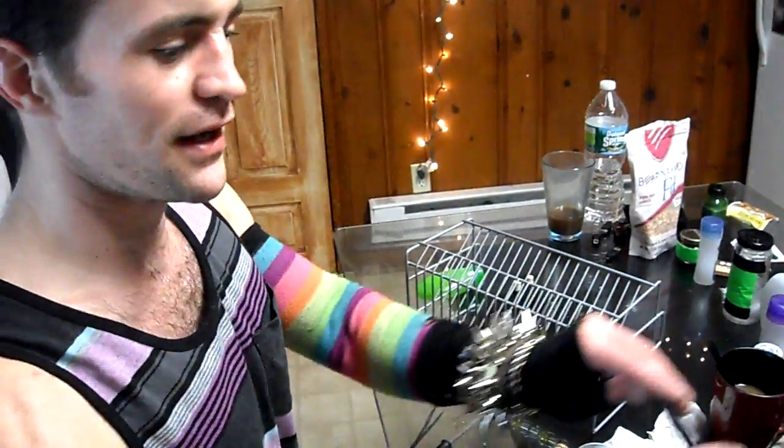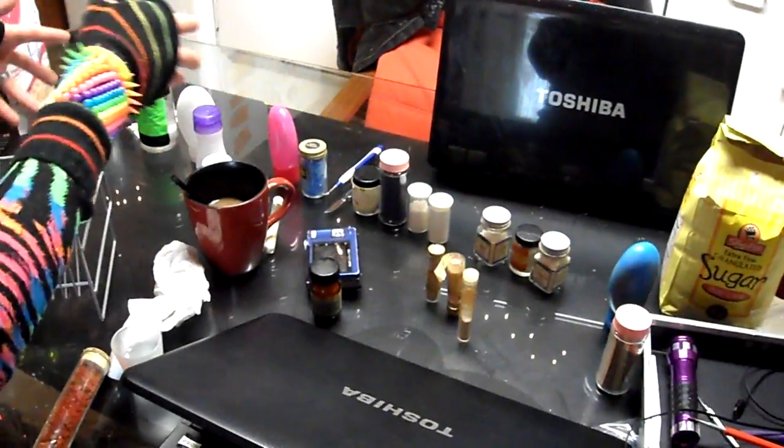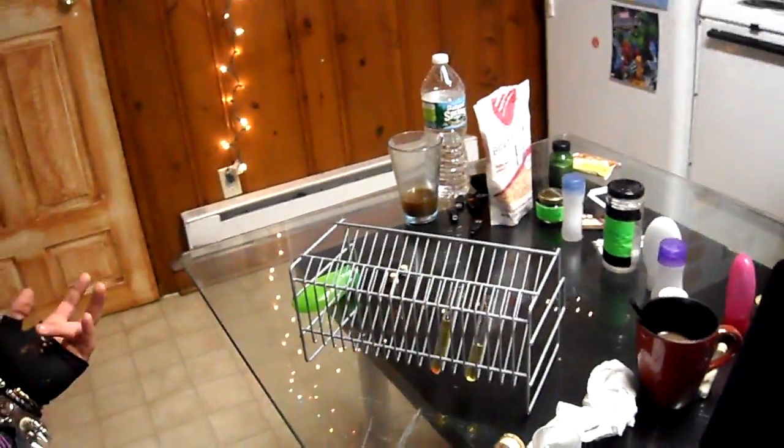Now if you take a look, all of these chemicals are going to be mixed with all of these samples individually, so that every time we do that it will produce a different reaction perhaps, and we'll be able to determine just what is in them by the reaction. That's all.